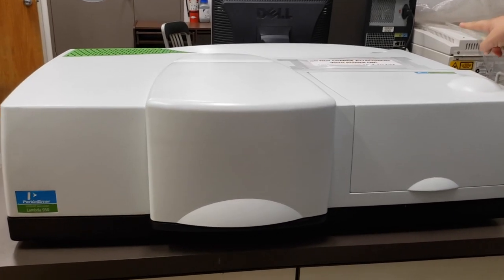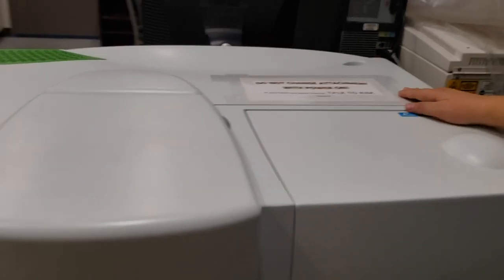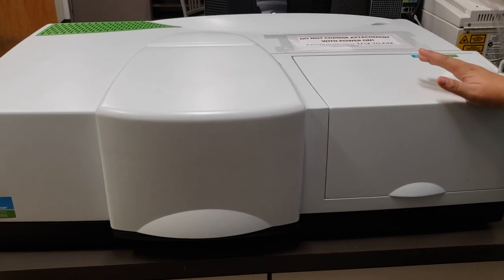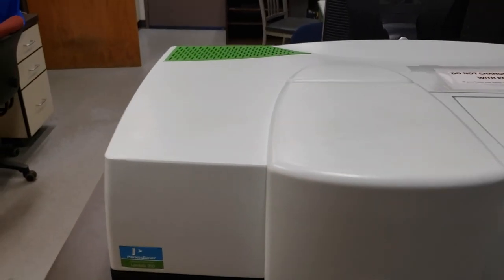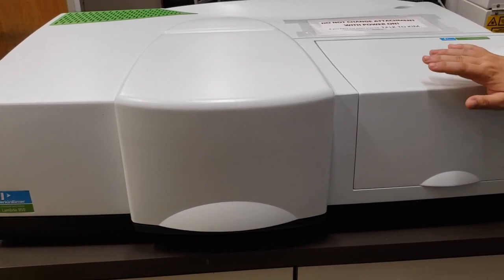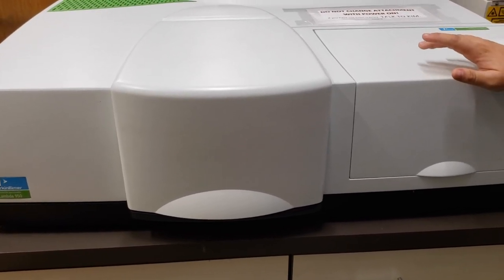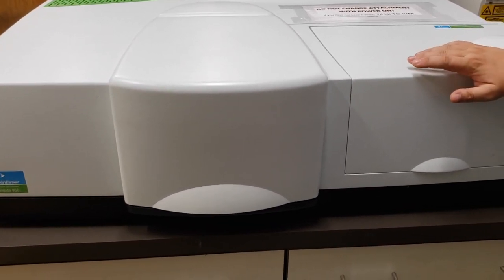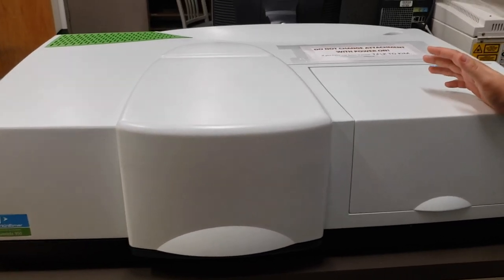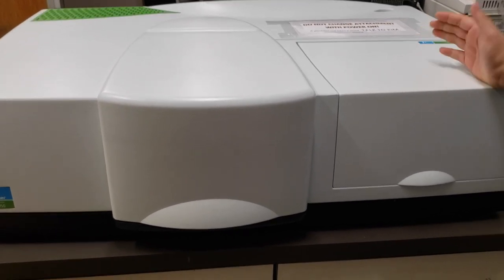The on button is a little flip switch in the top right corner of the machine. Within about a minute or two, you'll hear all the electronics start to warm up. You'll hear the monochromator go through a startup procedure, and you'll notice the green mesh in the top left starts to get warm as the lamps warm up. The lamps will get brighter over time as they get hotter, so you want a consistent light source before running any samples. If consistency doesn't matter to you, you're welcome to start after the five-minute startup procedure, but know that you won't have full or consistent light power over a long period of time.